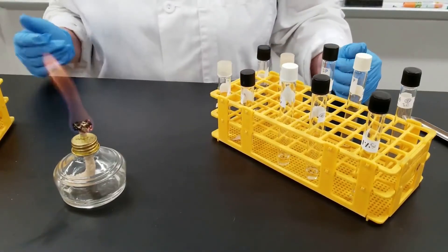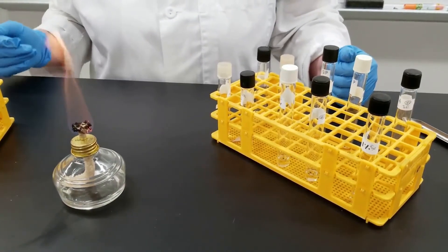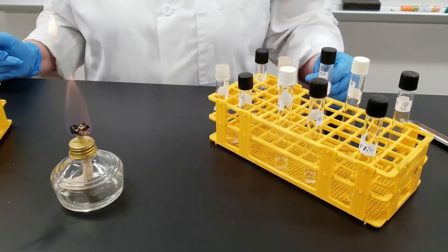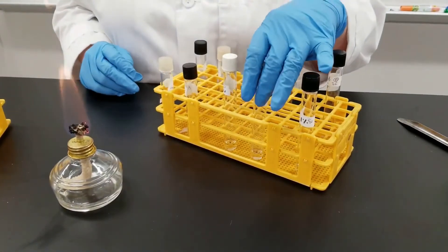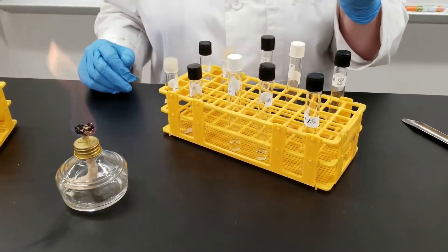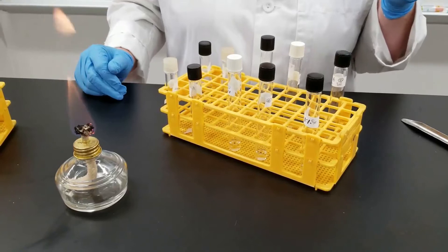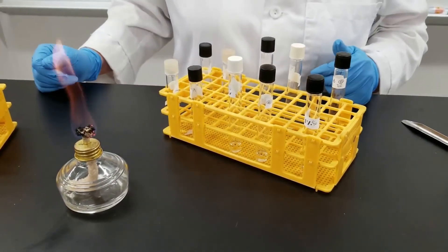In this experiment we're looking at preservatives that we tend to add to food and how they inhibit most bacterial growth. It won't necessarily inhibit all, but it will inhibit most. We're going to look at the effects of two different things here. I have tubes with nutrient broth, and I've also added various concentrations of salt — 1%, 5%, and 10% salt. Salt acts as a very good preservative, and most organisms cannot grow in high salt concentrations, which is why it acts as a preservative.